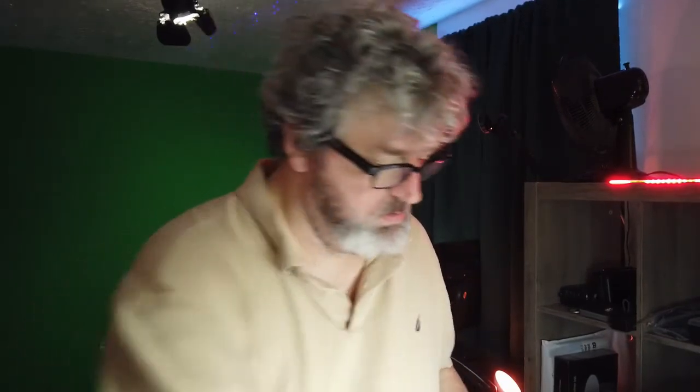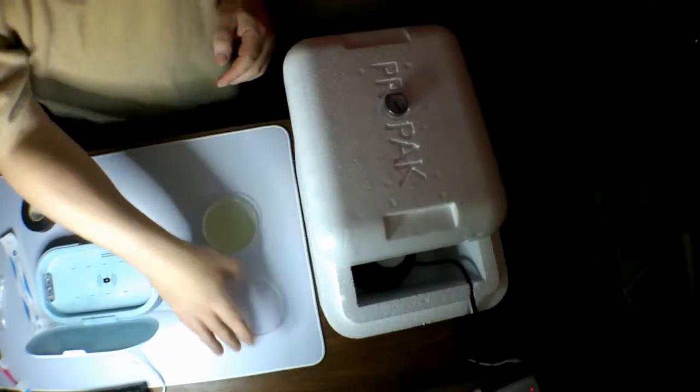Now, I think the next thing we're going to do is the toothbrush. I'm not going to put any more oil in there. It was a nice experiment. We have the extra essential oils to play with later. But I don't really want to put more oil and get oil all over my tooth. You know, I don't need my toothbrush to taste like orange essential oil. I think that's going to be kind of gross. All right, so let us get out our petri dish. Toothbrush.